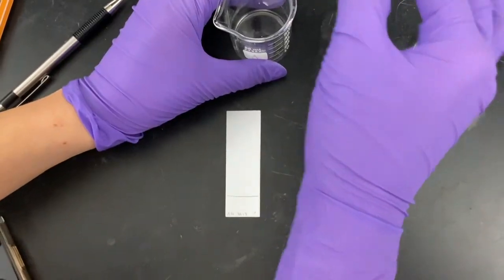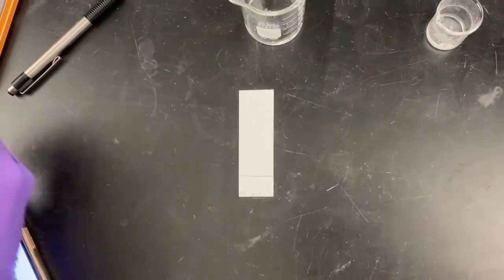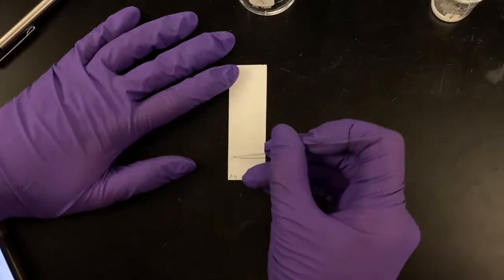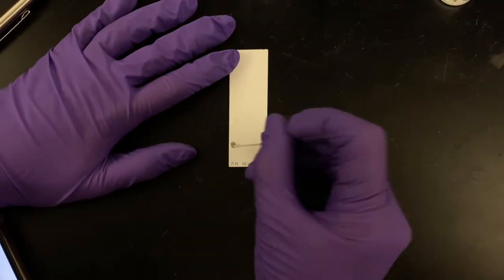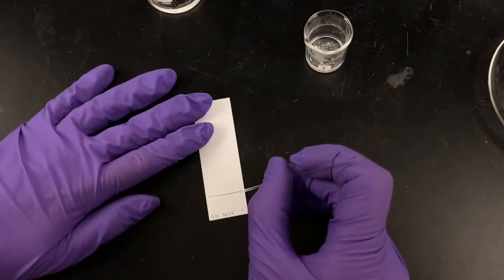You will now run an additional TLC plate to confirm your results. In our case, we ran our hypothesized drug, Anacin, in a mix of Anacin with our unknown compound, as well as the unknown compound on its own.